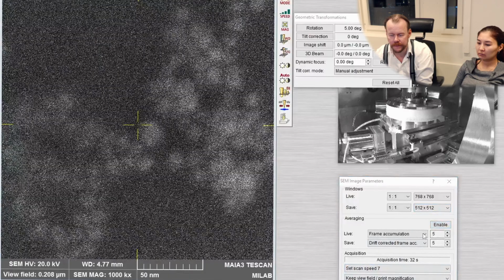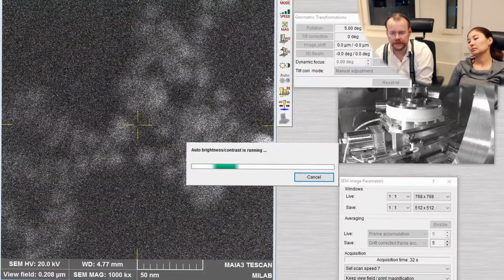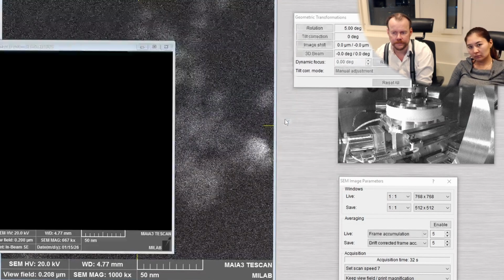You see that we have a little bit drift since these particles are on that thin carbon film, and that moves a little bit and so on. But we can try to scan this image. Let's try to make an image now. Small. We take the smallest pixel size now, and we want to scan it without any integration here. Auto contrast. And we scan the image.